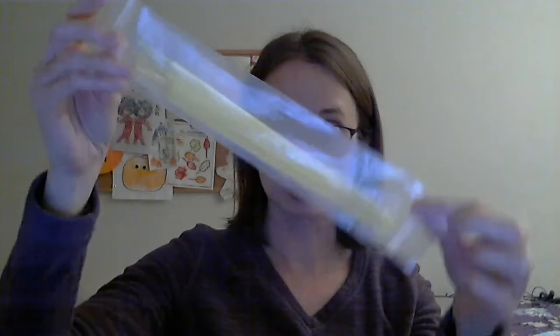The same thing goes for the sterile loops. Once you take one out, don't set it on your bench because it's going to pick up bacteria from the bench. Don't wave it around in the air. Keep it sterile, which means you take it out only when you want to use it, use it right away, and don't set it anywhere else.